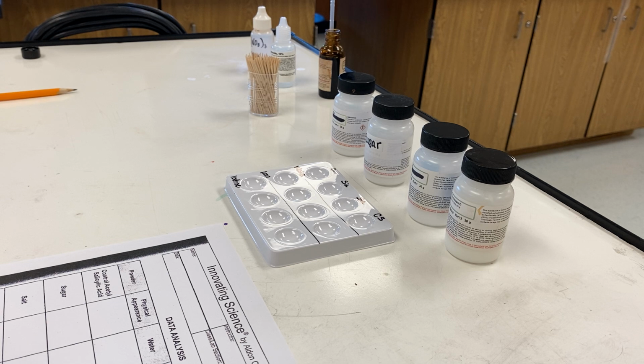When police investigators arrived and confirmed the students' stories, they immediately ordered every science teacher to take inventory of all chemicals in his or her lab, as well as asking the school nurse to inventory all medicines in the school infirmary. Science teachers reported back that everything was accounted for. However, the school nurse reported that a large bottle of aspirin crystals was missing. She typically kept them on hand for students that didn't like to take pills, and she could mix it in with different types of juice.